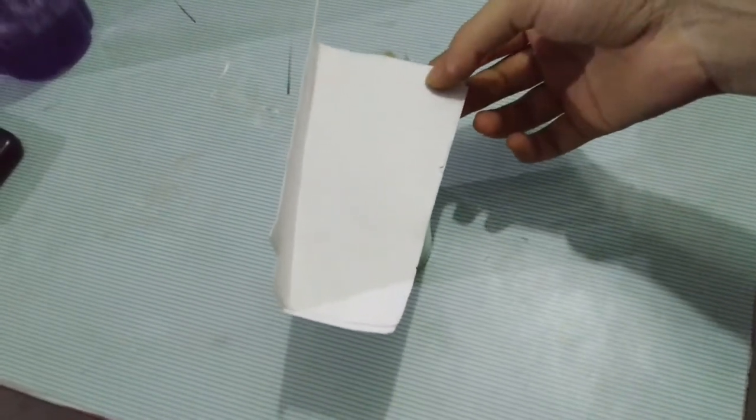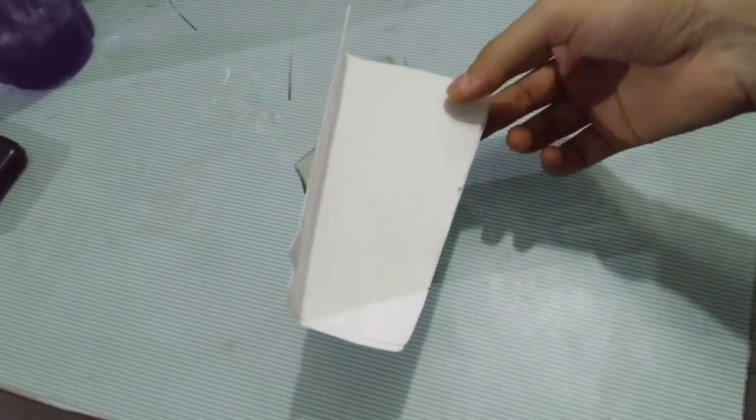So students, after keeping that copper sulfate and iron solution overnight, we are back to see the change. Now I am removing the lid to see what surprise is left behind.